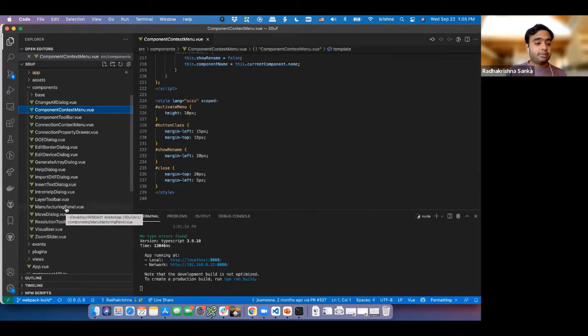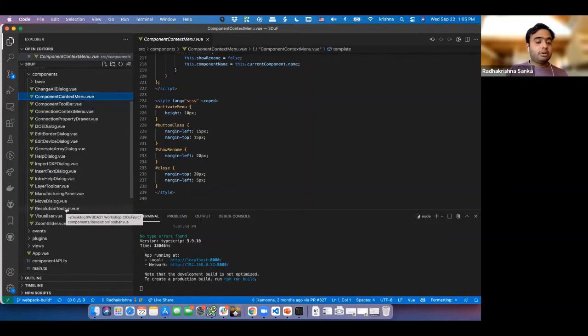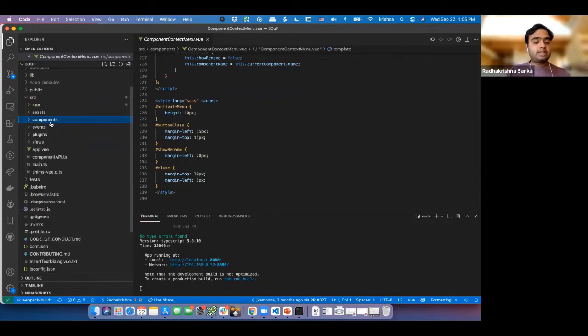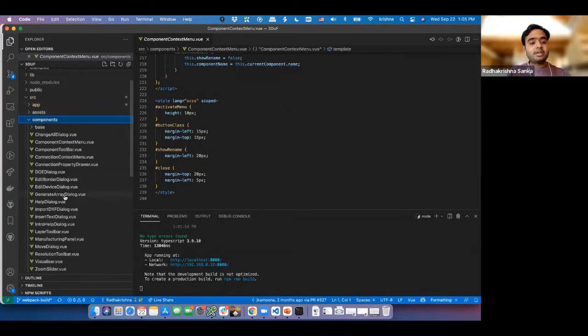So that's the first step. In order to add a new component, what do we go about doing for that? So let's keep this over here. Now we know how to modify the UI. By modifying something over here, you can modify what the UI shows.